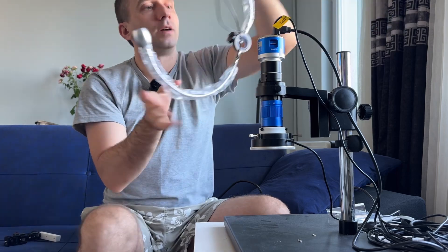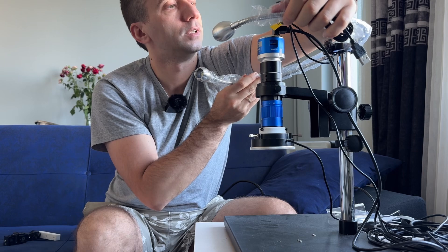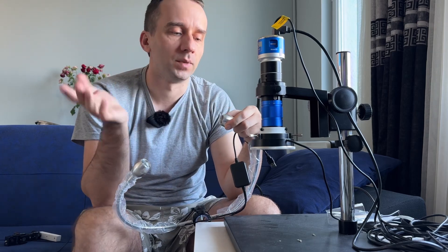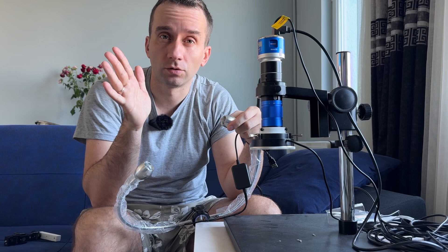25 millimeters rod, hole for rod — and it is this polarization filter here, but it's too expensive. Maybe 100 US dollars, maybe even plus.